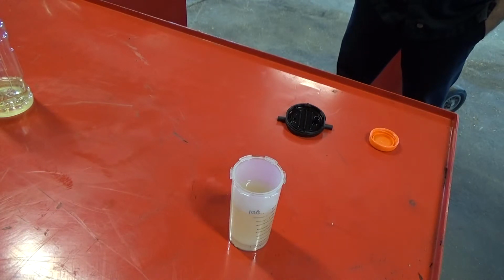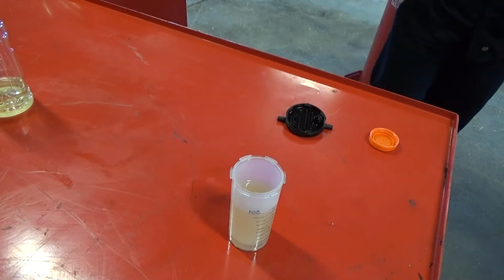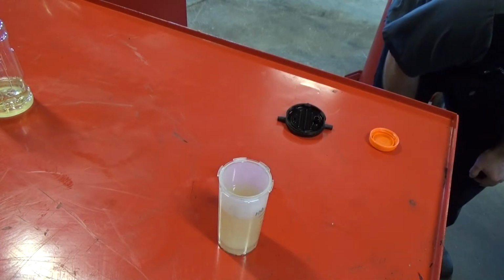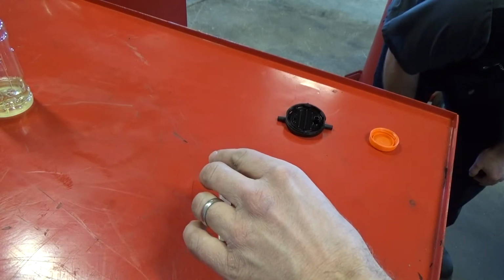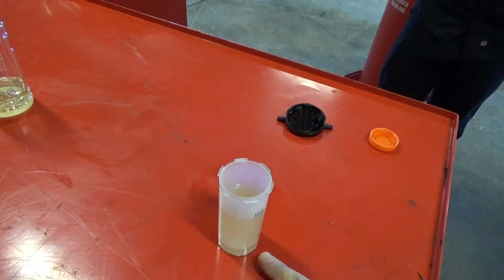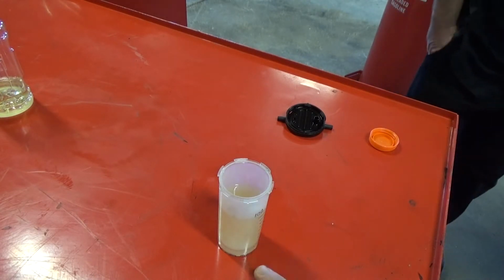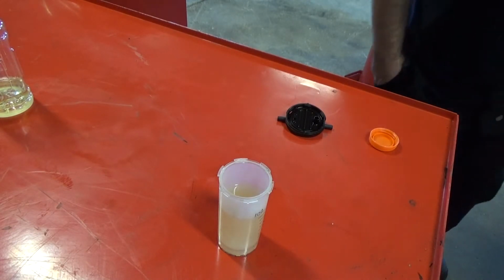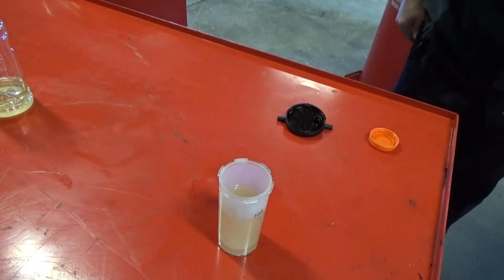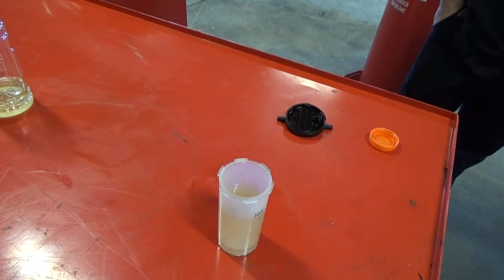So anyways, what we can see there is that that line went up, not quite halfway. It's close. You can barely see that division line in there. If I pivot this a little bit from the top. Yeah, I spilled it a little bit, didn't I? Yep, from where I sloshed. But you're going to see it's not quite to 20%. It's close. It's probably like 18.